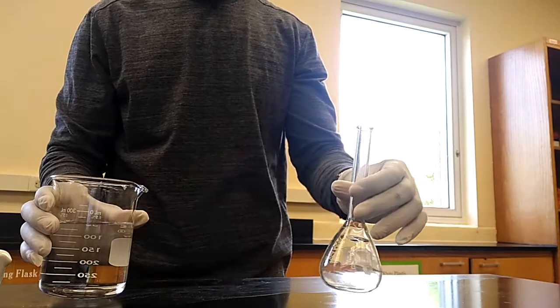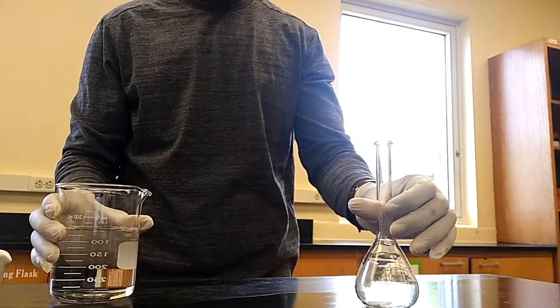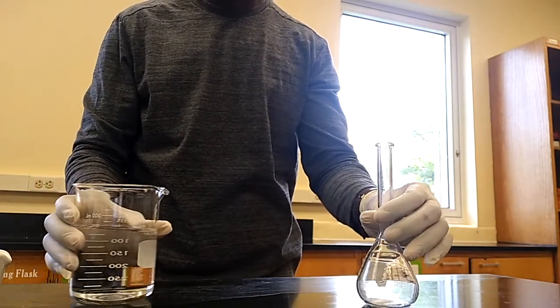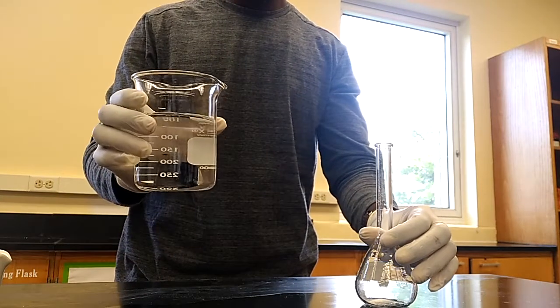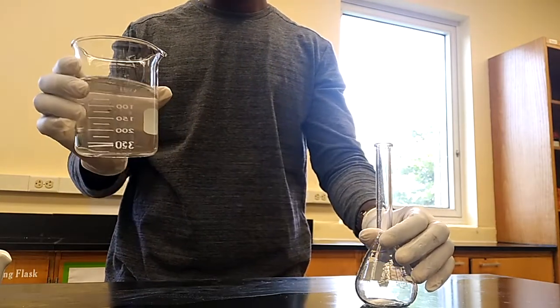After the weighed salicylic acid has been transferred into the volumetric flask, now I want to add the 0.1 molar sodium hydroxide.